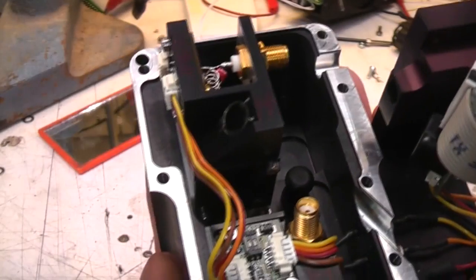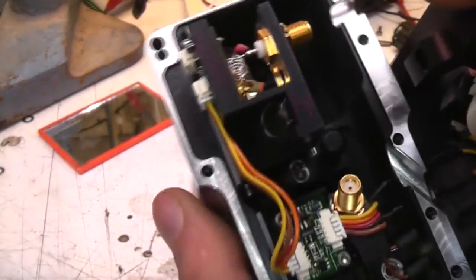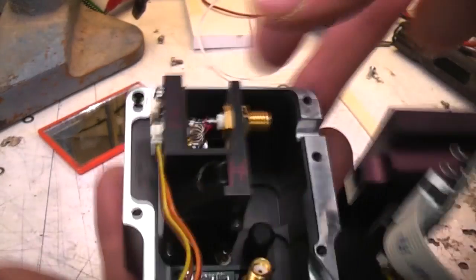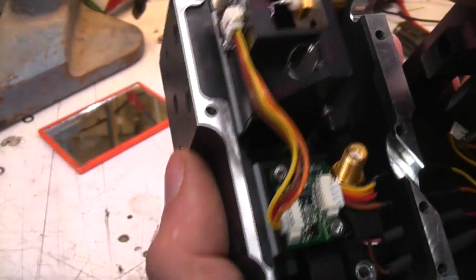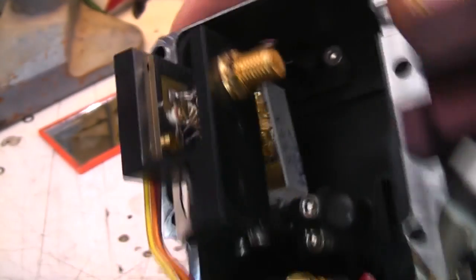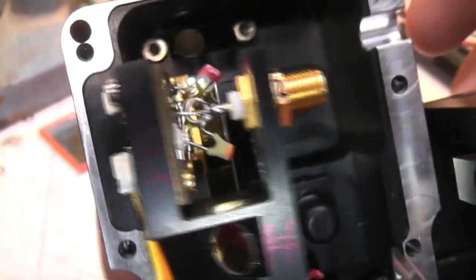So I suspect, because one of the diagrams I found showed just a moving filter assembly, that this is a replaceable module, so they want to keep the beam path the same, so they could either put a set of standard filters in or put this module in, depending on what the customer ordered. Because I'm guessing this is probably quite a lot more expensive than a set of filters, so the customers that need the flexibility of easily selectable wavelengths stick this in. So they've put this little periscope thing in there because as the beam goes through the crystal, it gets deflected sideways slightly, so this is probably just to recorrect that to keep the beam in line. So they've got the same optics for both versions of the product.